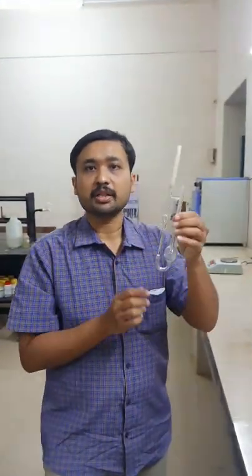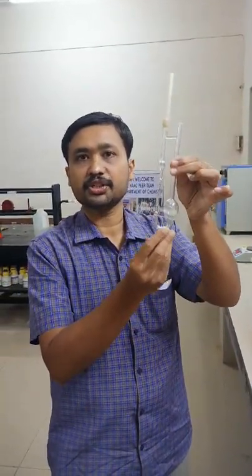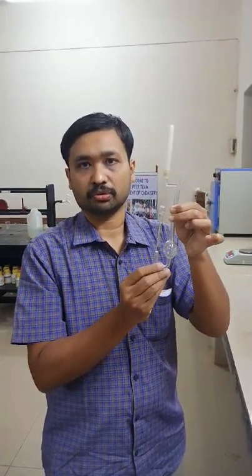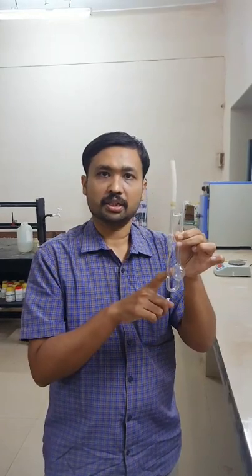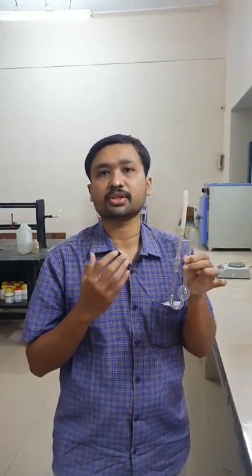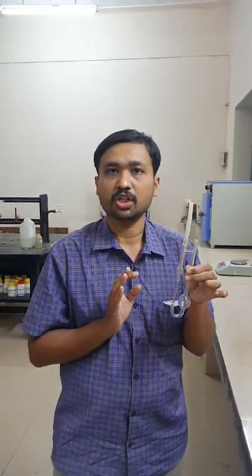Before starting the experiment, make sure that the apparatus is clean and dry. If it is not clean or dry, please clean it using acetone. Since this apparatus is already clean, I will not wash it again. Now I have to transfer the organic liquid into the viscometer. It is always better to first take the liquid into the apparatus — whether measuring coefficient of viscosity or density, it is advisable to do the experiment with the liquid first and then with distilled water.